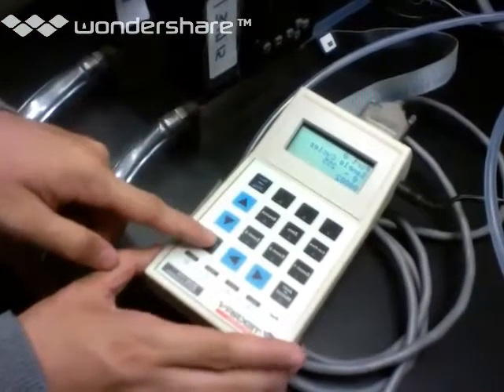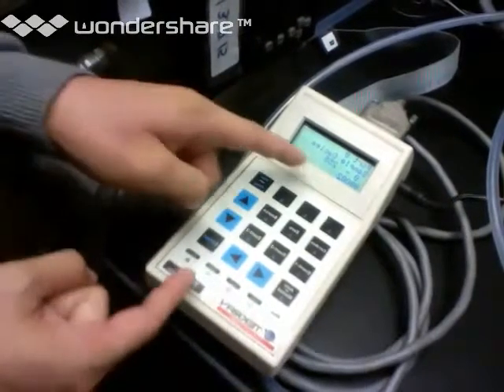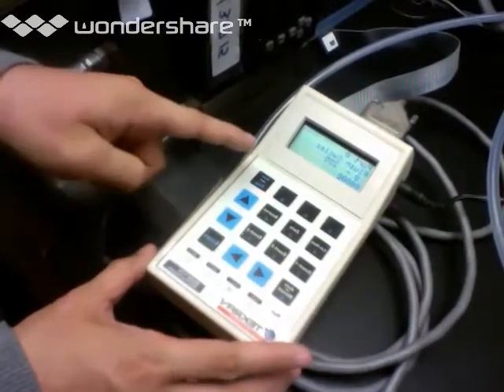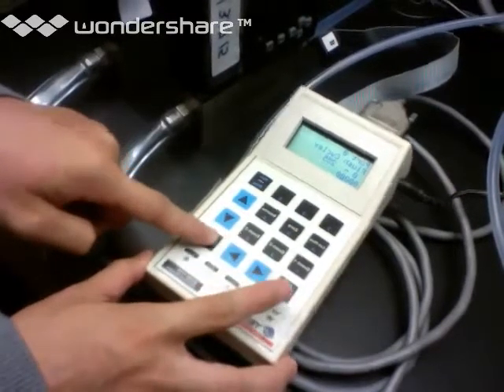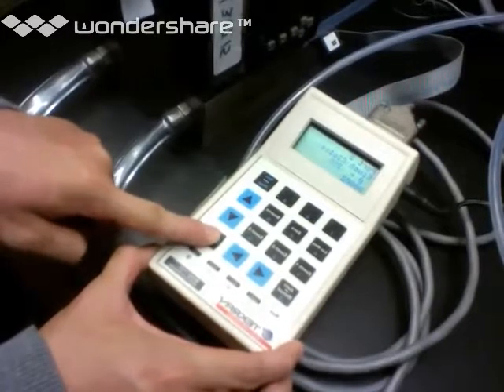Okay. So, port 0, sample cycles, it's going to be 2, right, for trap A and trap B. So you're going to leave this on 2 sample cycles. Actually, I should go back. Alright, hold on, sorry. Let me go all the way back to the front.